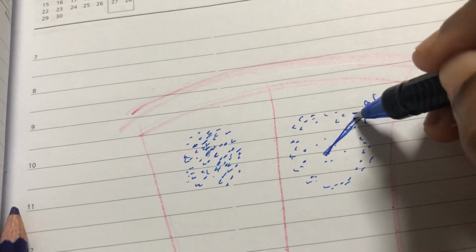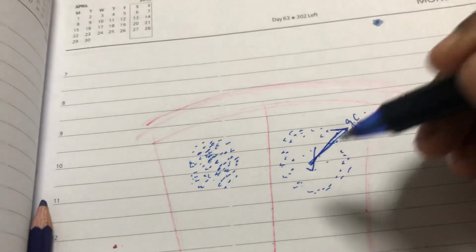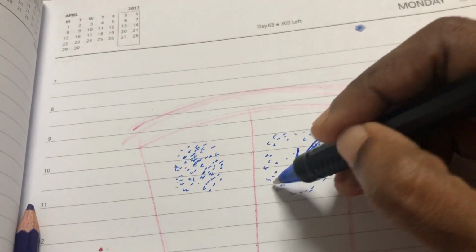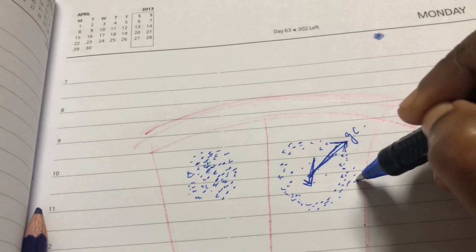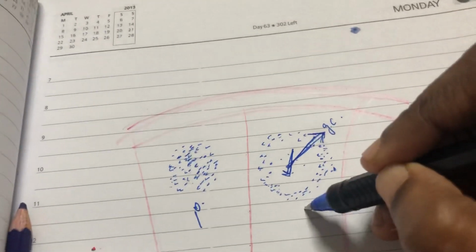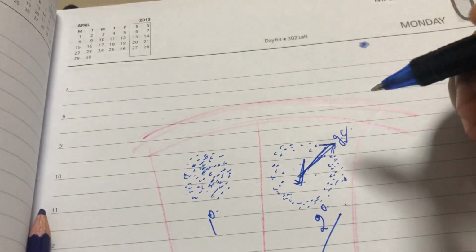If your body is having an antigen-antibody reaction, this germinal center will definitely be there, because here you have the active lymphocytes, and in the peripheral zone you have the resting B lymphocytes. So this is called the primary lymphoid follicle and this is the secondary follicle. The important feature of the secondary follicle is the germinal center.